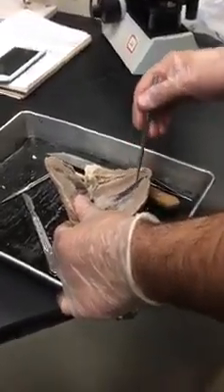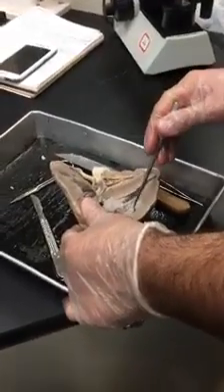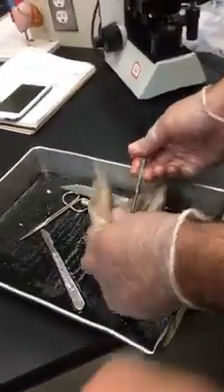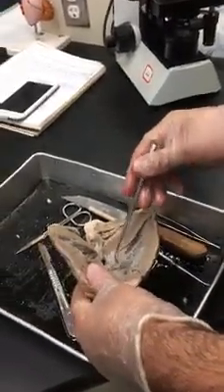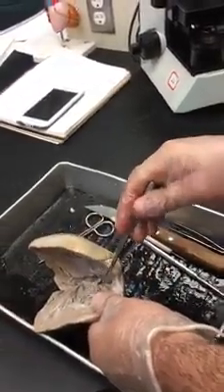The right and left ventricle are enormous — so big. This is the papillary muscle and the chordae tendineae. The chordae tendineae are very strong tendons; I can lift the entire heart with even one of them. These are the flaps of the valves.